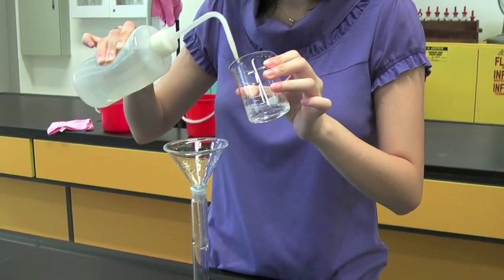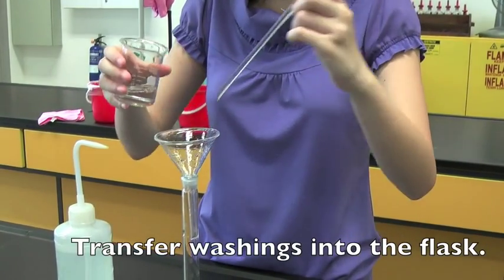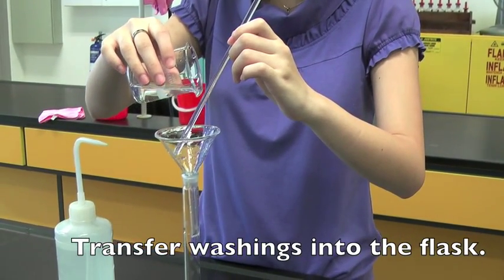To ensure all solution is transferred, rinse the beaker with distilled water and transfer the washings into the flask.